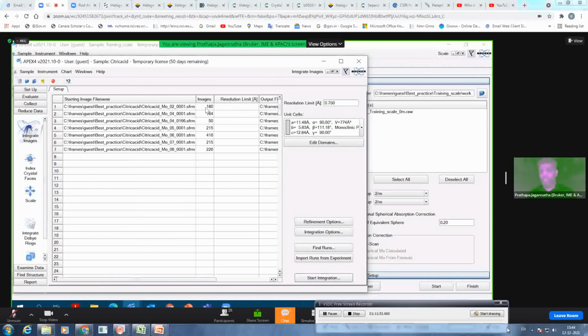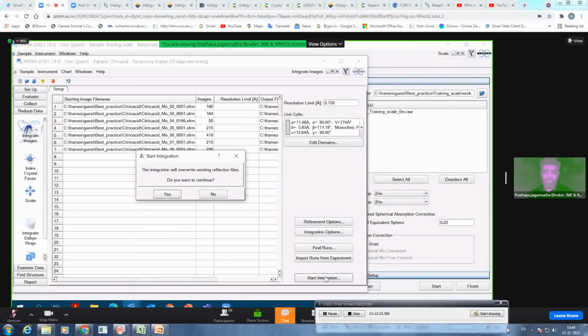And as you know, if certain frames are affected by ice, or crystal slippage or something, then you can tell the software that in the second run you want to integrate from first to 50, and from 50 to 60 you don't have any signal, so after 60 you want to integrate. So you can do that here, controlling the images, and you can also control the resolution limit for each run. Okay, so let's start integrating without changing anything.